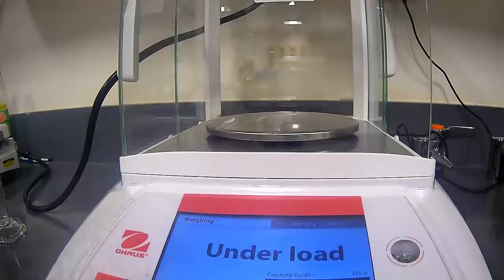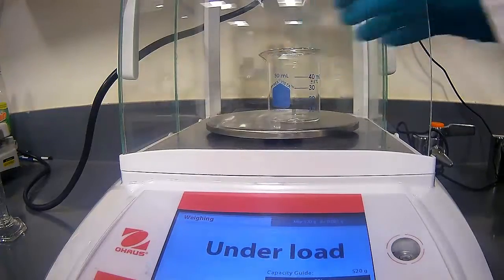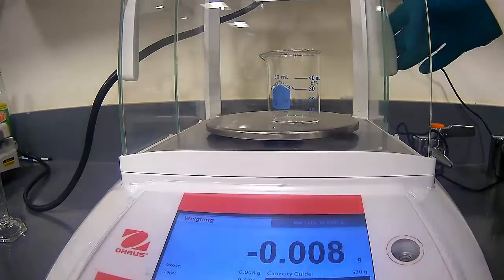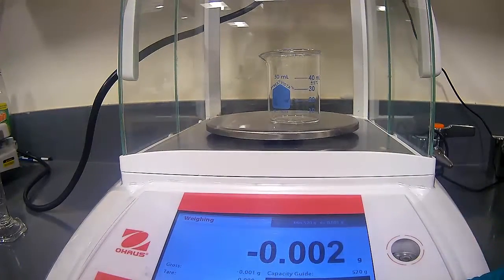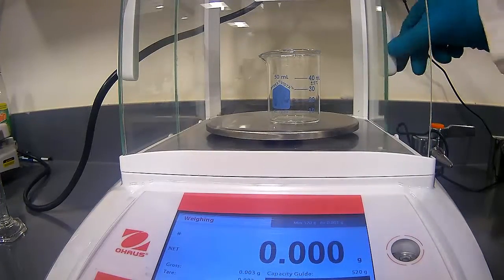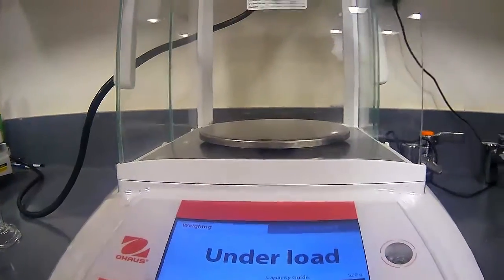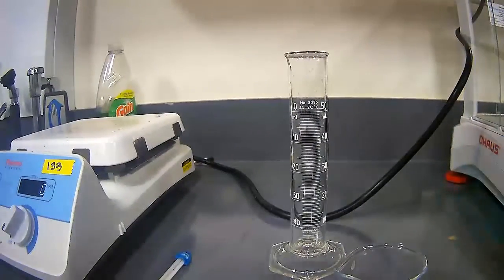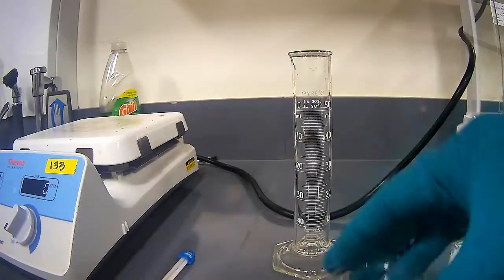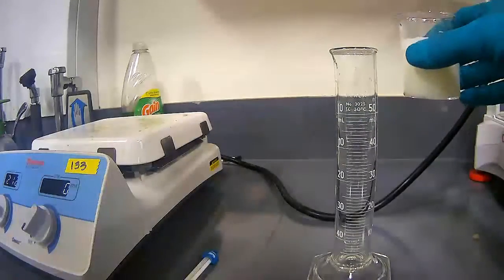So I'm going to start with a 50 milliliter beaker. And I'm going to go ahead and put it on a scale and tare that scale. Taring the scale zeros it. So we now have our scale set at 0. I am then going to measure out and put in 20 milliliters of milk into it. And here you see a beaker, the beaker that I'm going to be putting my milk into, and a graduated cylinder that I'll be using for measuring my milk out. And I want 20 milliliters.